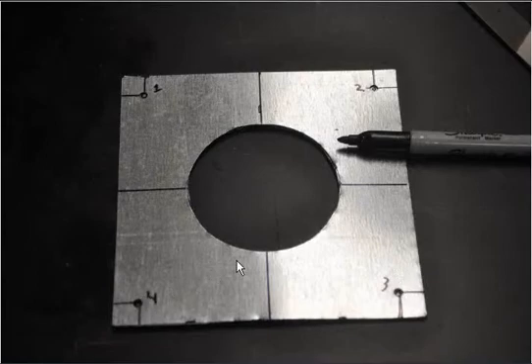The reason we do this is that since we've cut it by hand, they're not necessarily lined up directly. It's not precisely machined, so we want to build it part by part and fit it together when we make it. So we're going to mark the holes on the second plate so that the two holes in the center are aligned together.